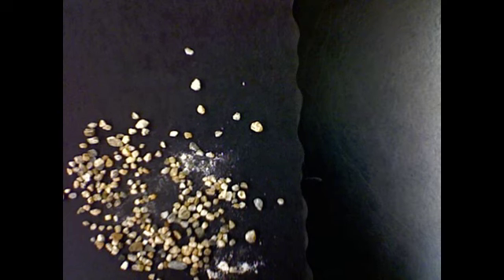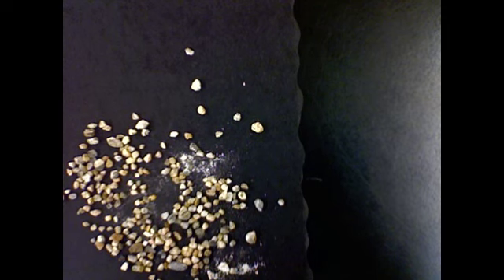I've heard a lot of students in class say that gravel size kind of reminds them of the size of, is it Nerds or Runts? Nerds, those little candies. The gravel's about that size. And one useful description could be it's definitely bigger than the size of your pencil tip, but smaller than the size of your pencil eraser.